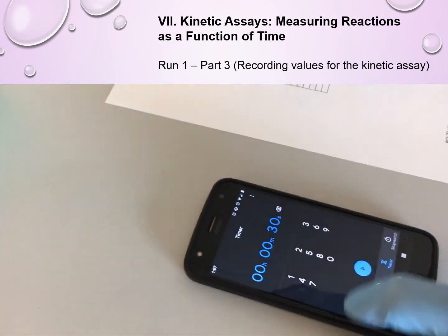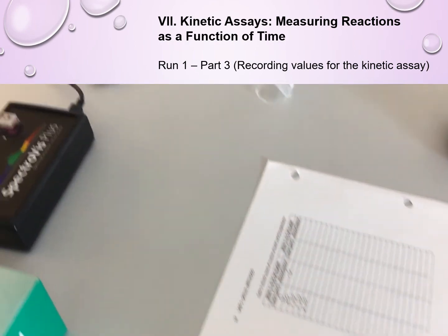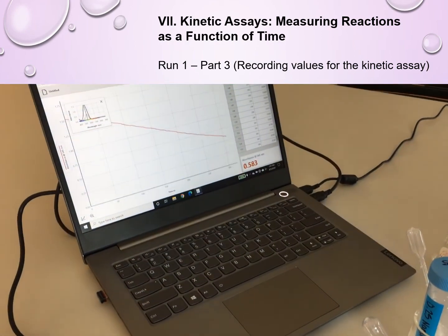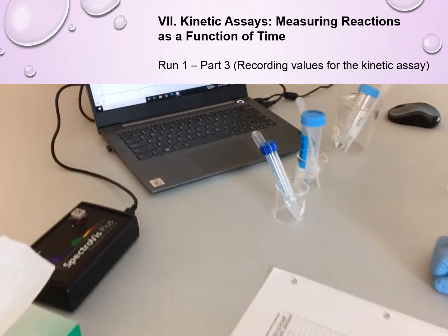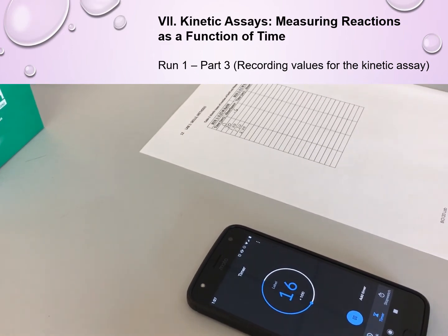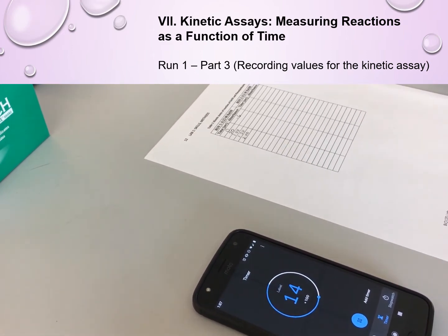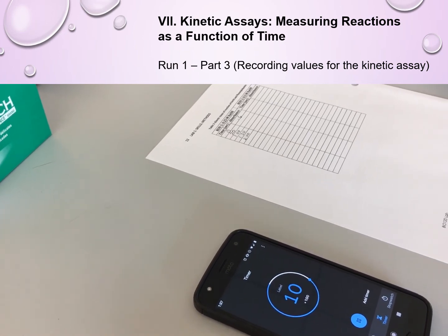So Aaron is now writing that down, starting his timer for 30 seconds. So after 30 seconds have elapsed, he's going to now check what the value is on the monitor and record that in the table. So a few more seconds, and then he will continue doing that every 30 seconds.